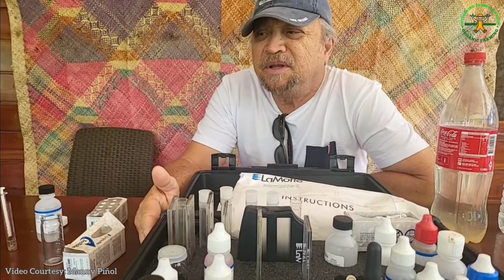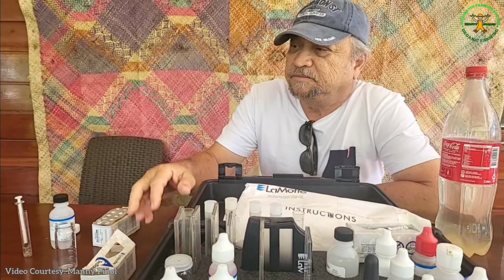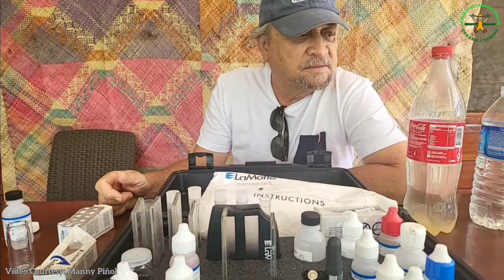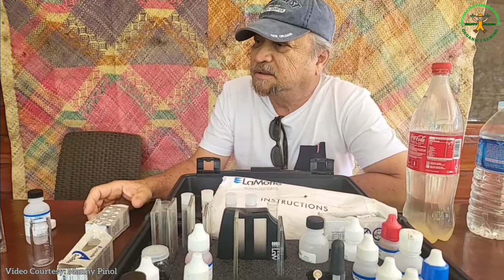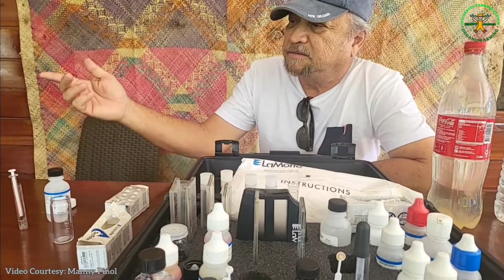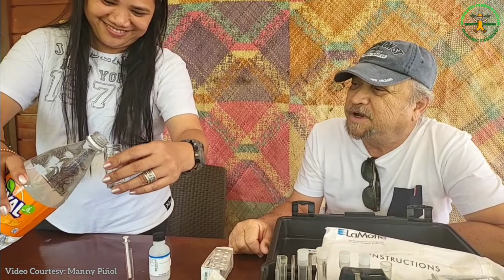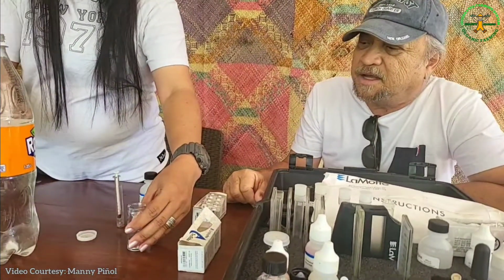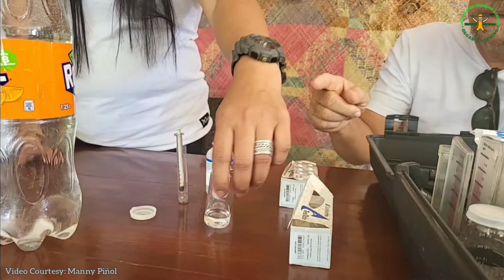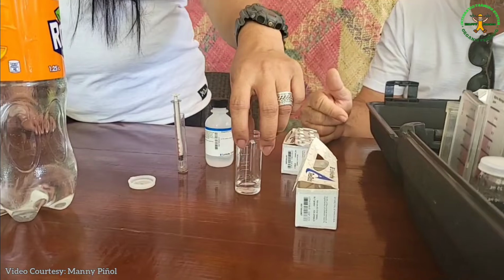Okay. So we have two samples here, Rocky. One from my well, this one, and the other from the well of my brother, Colonel Pat. Can we conduct the test now? Sure. Do the works. This is my assistant, Joyce, and I've been training her to do this simple test. What did you put in there? That's 5 ml of the water from your adjacent well.